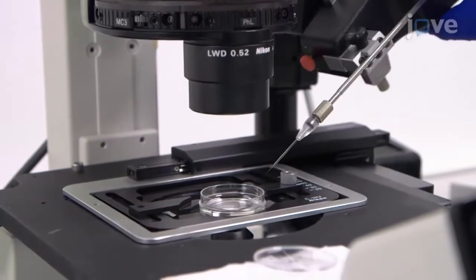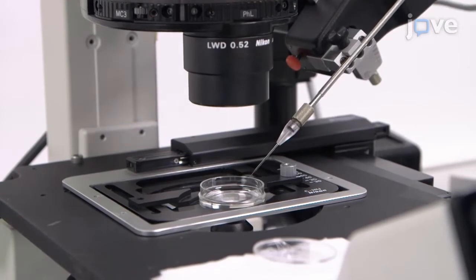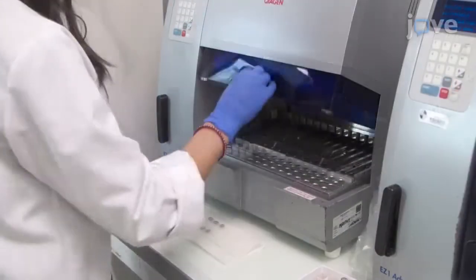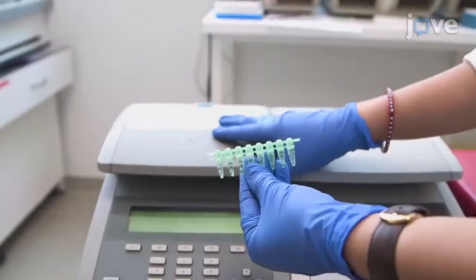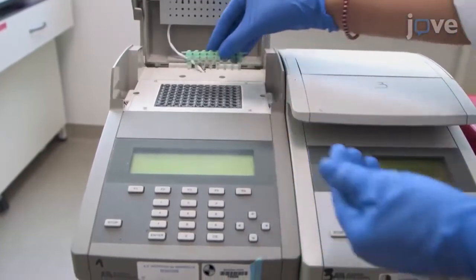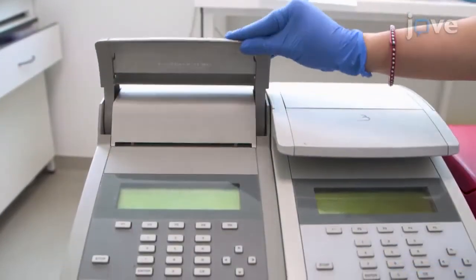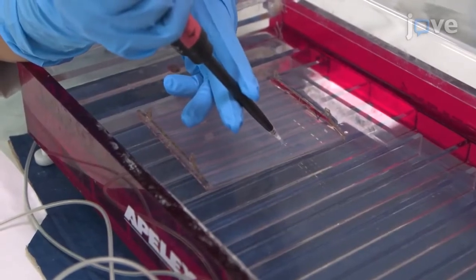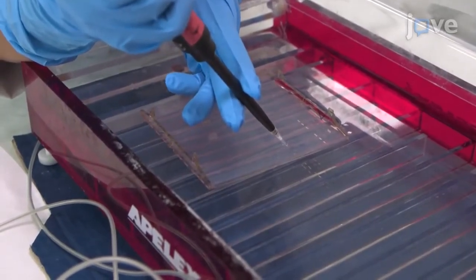This approach resolved the major problem of virus separation. It is a perspective for cloning amoeba or cloning protists in general. The person who is trying to use this technique for the first time must be rigorous and precise when controlling pressure. The visual control is essential to confirm the capture and the release of only one cell.